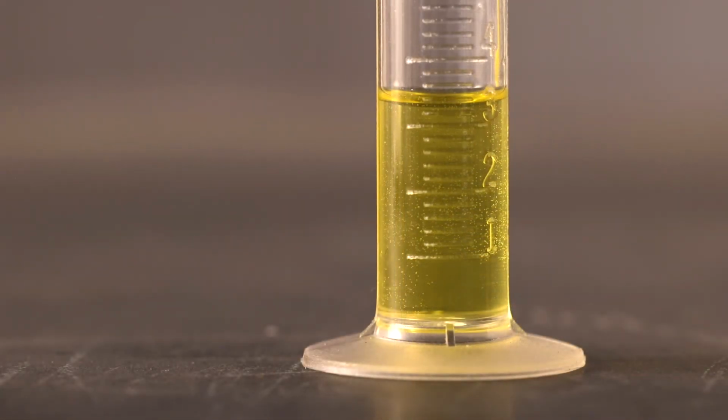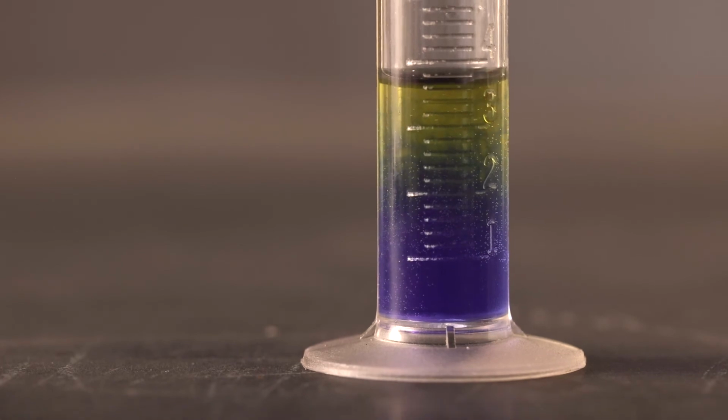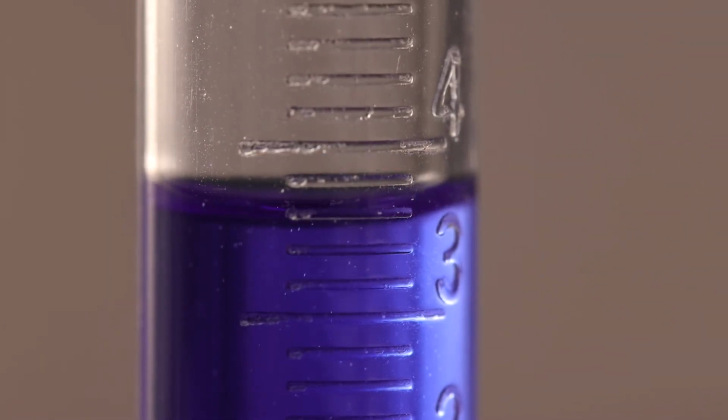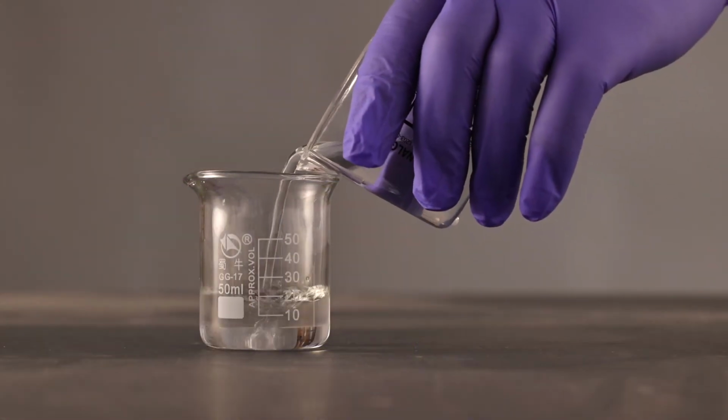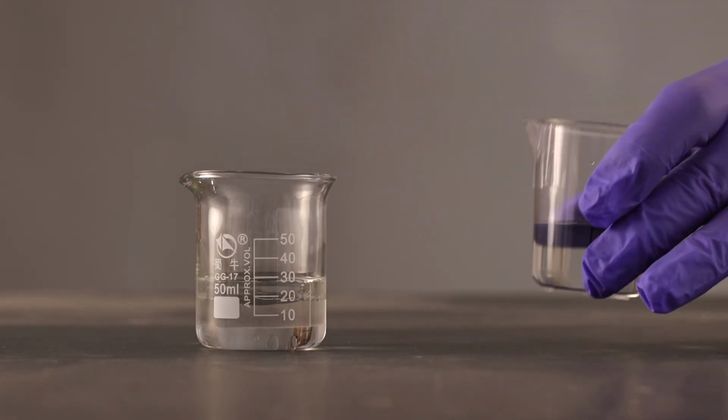Sample 1 turned blue in 5 drops, and subtracting it from the blank of 50 shows a delta of 45, which is in normal operating range. Sample 2 turned blue at over 45 drops, and subtracting it from the blank of 50 shows a delta of 5, which tells us to discard the solvent as it is unacceptable. You can see how different the results were and how much water can be a factor.